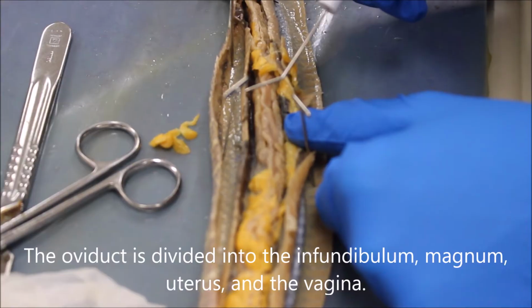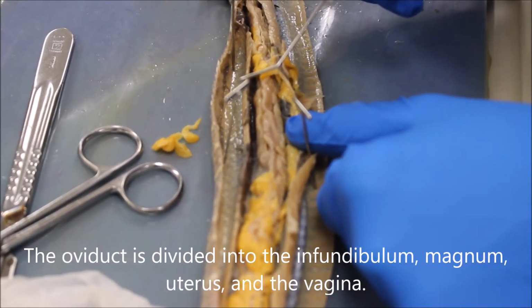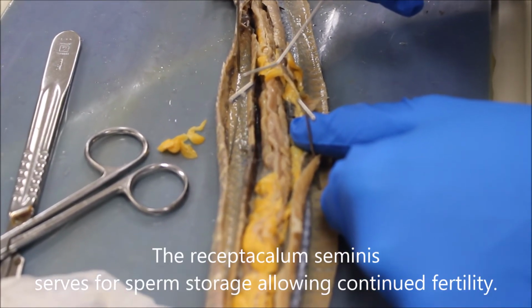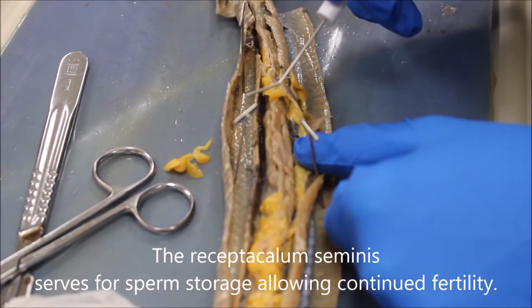The oviduct is divided into the infundibulum, magnum, uterus, and the vagina. The receptaculum seminis serves for sperm storage, allowing continued fertility.